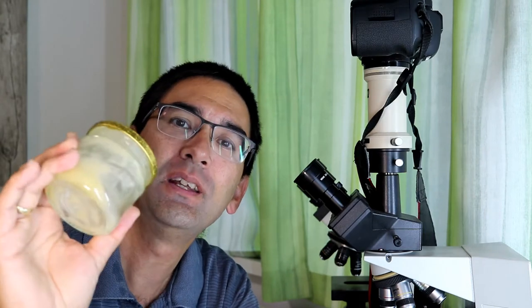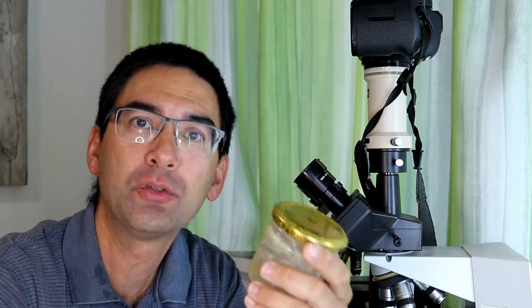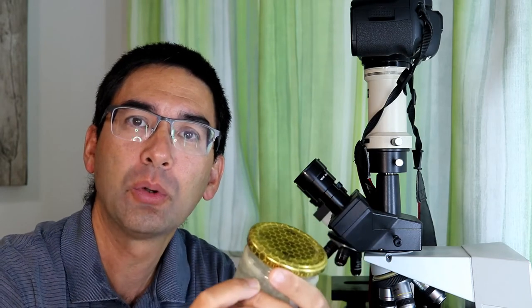Hello and welcome. A few days ago I looked at small sugar crystals in honey using polarized light. But honey is also quite interesting to observe because there could be pollen grains inside the honey, pollen that the bees collected while they were collecting nectar.